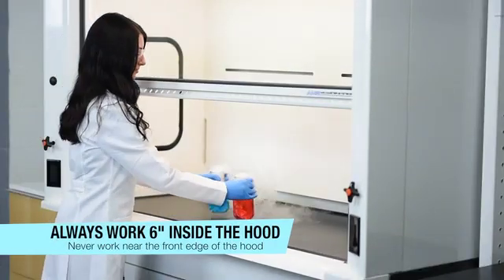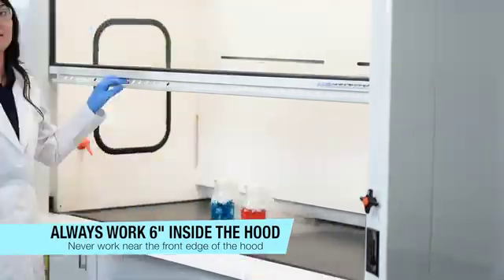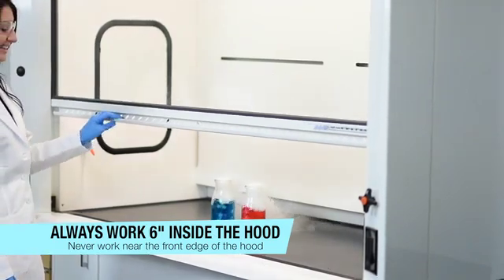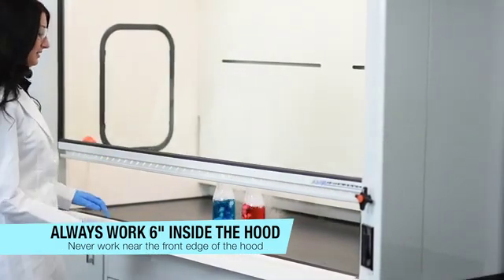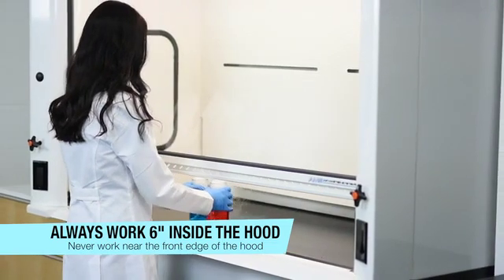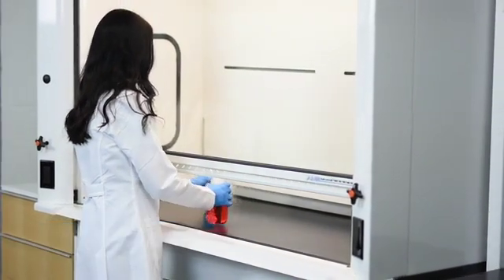Always be working at a minimum of 6 inches inside of your fume hood. And always make sure that your sash is closed so it is below your face. The lower the better, is always safer. This looks a lot better. Great job, Marissa!